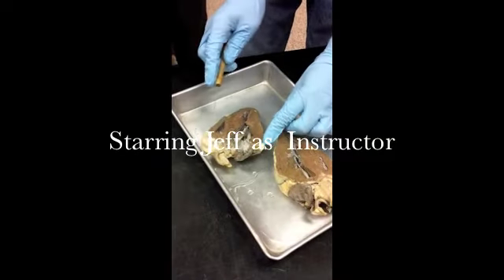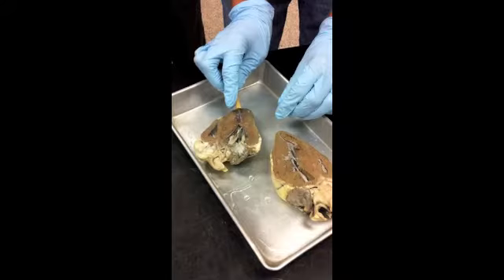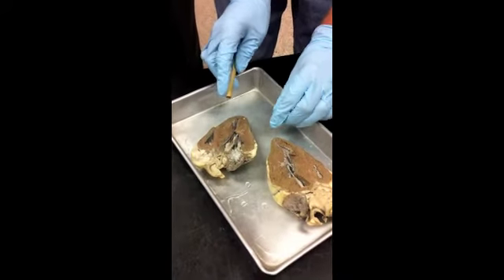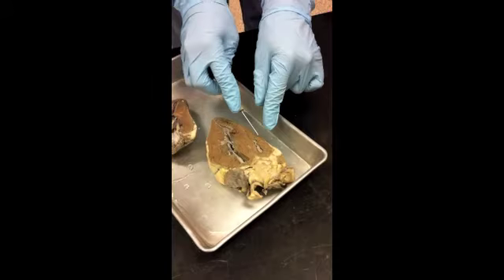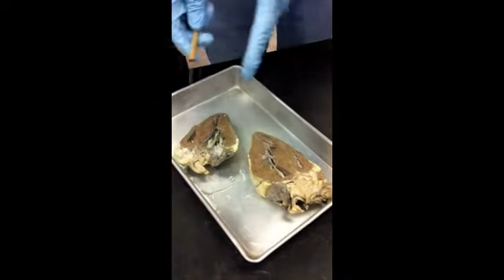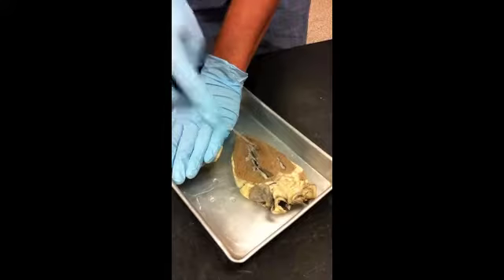Whenever you cut this open, you can tell which is the right and which is the left side by looking at the ventricles down here, because the outer wall of the left ventricle is always a lot bigger than the right. So that's how you can tell this is the left side and that's the right side. So what side is this? The right side, and this is the left, right? It might be different depending on whatever I put out there, so just keep that in mind. If you just saw that, that'd be left, that'd be right. But if you just saw that, that's going to be the right, that's going to be the left. Okay?